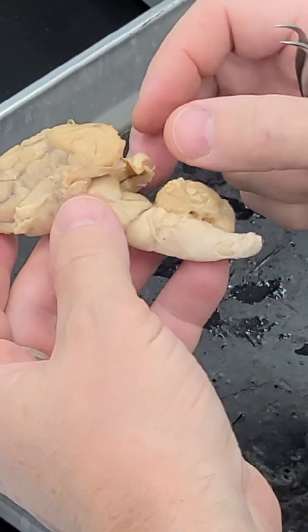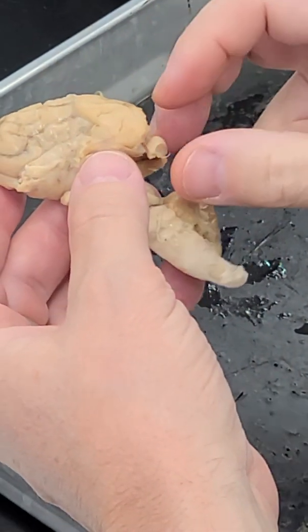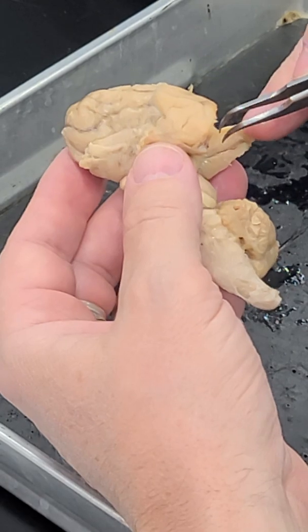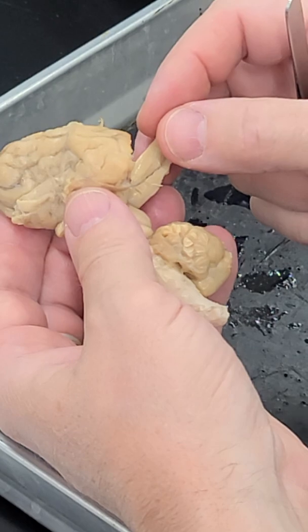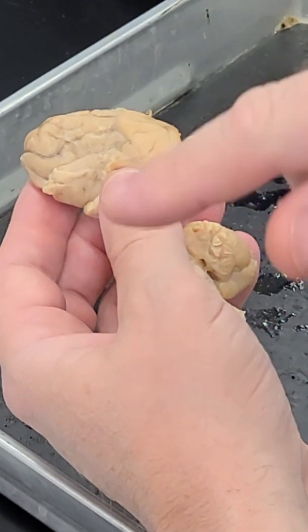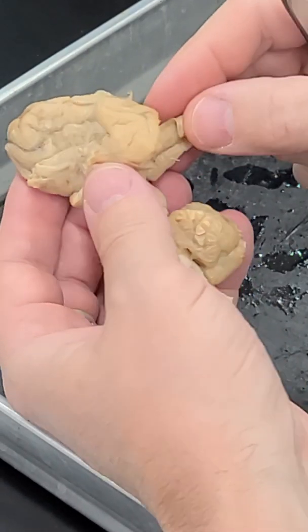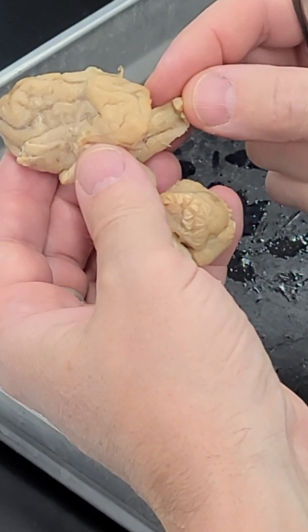And if we look at the ventral surface of the hippocampus, a couple of structures beside the fimbria that are pointed out in your lab book are the dentate gyrus, which in this view is just kind of the tissue in the middle, just caudal to the fimbria. And that's a gyrus just like in other parts of the cortex. And then right next to that, where we have this blood vessel running, you can see that dark streak, that little line, that's the hippocampal fissure.